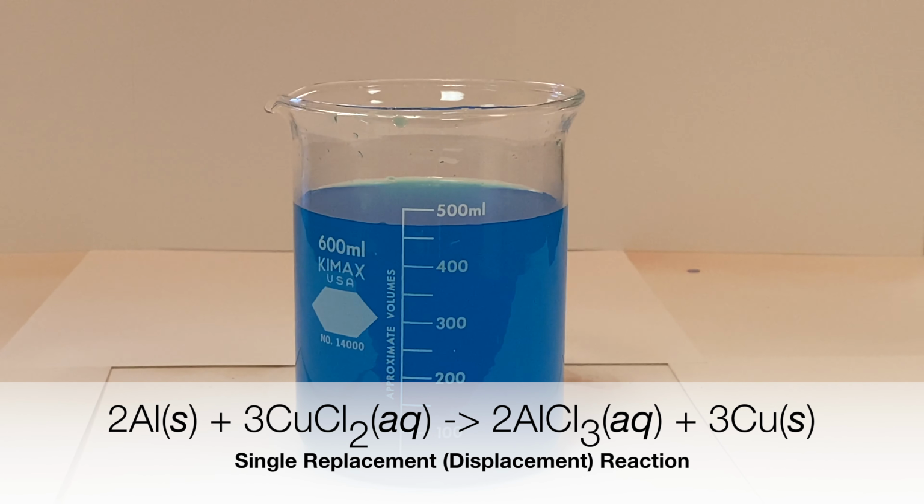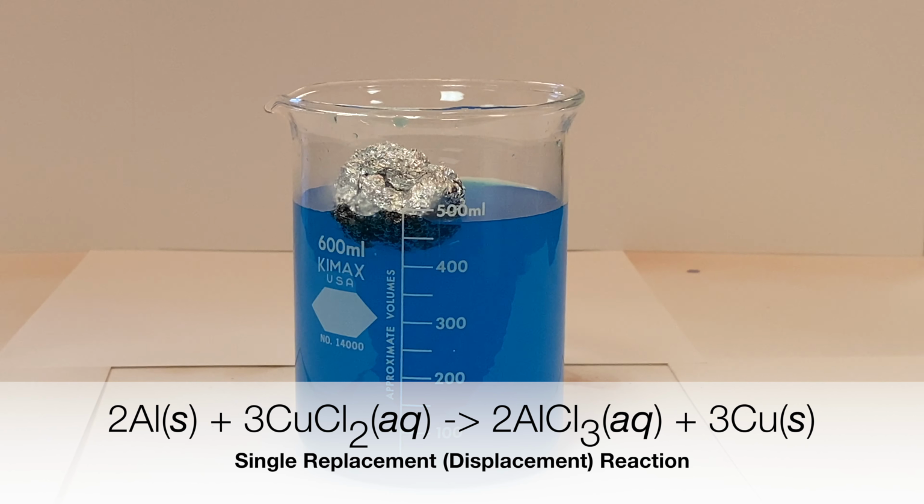Our next category of reaction is called a single replacement reaction, sometimes also called a single displacement reaction. In this reaction, we're going to take elemental aluminum and react it with a solution of copper chloride. When these two are reacted, the metals that are reacting, in this case, switch places.